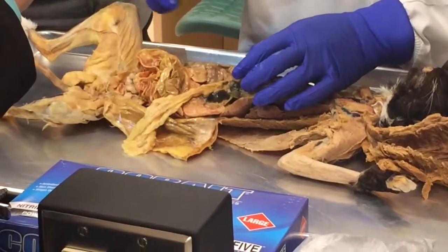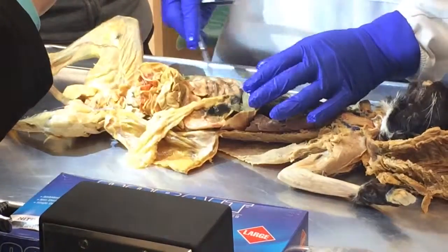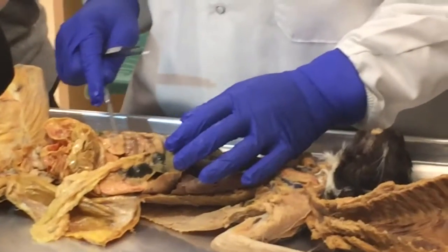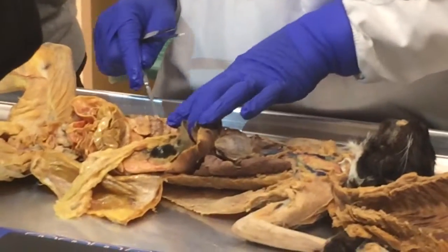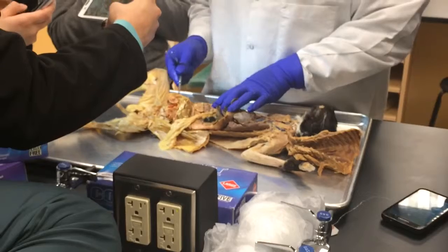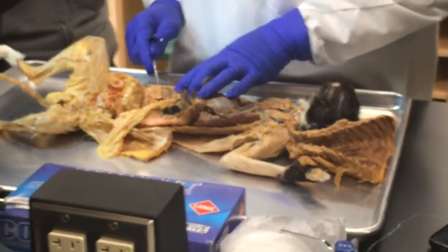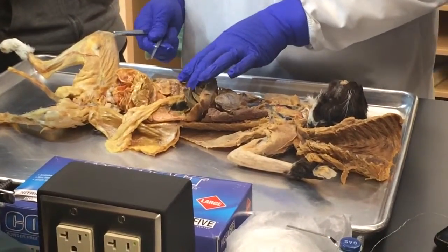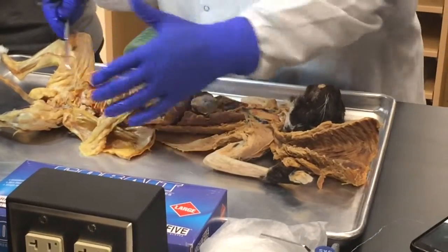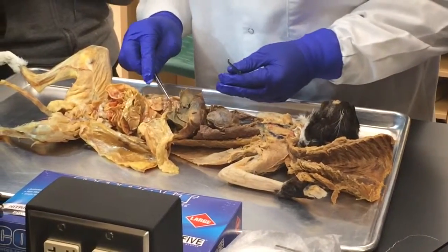So now we go to the small intestine. The first part out of the stomach is the duodenum, which we said is 25 centimeters long in the human. And the hormones from here are secretin and cholecystokinin, all right? They go into the blood and then come back, because this is like 6 meters long. If they are secreted by this part, it's only going to affect this part, which was what Patrick was asking. Now I remember his name. So it goes in the blood and then perfuses all of these blood vessels. So duodenum, which is right there.